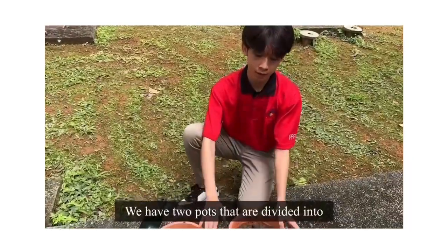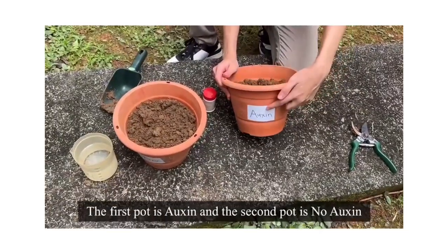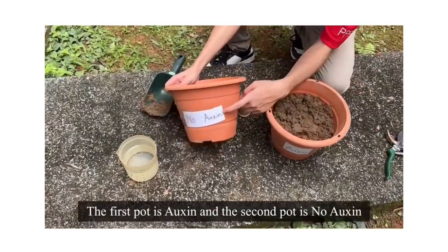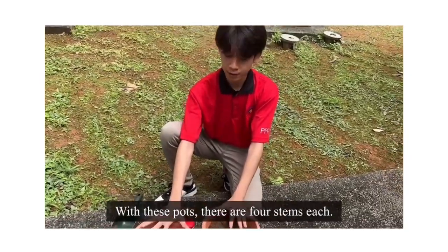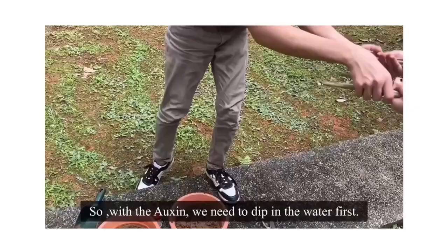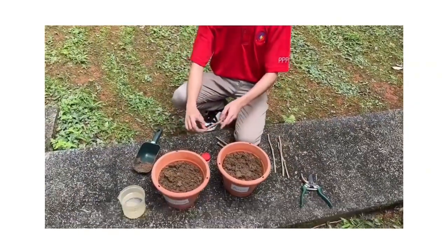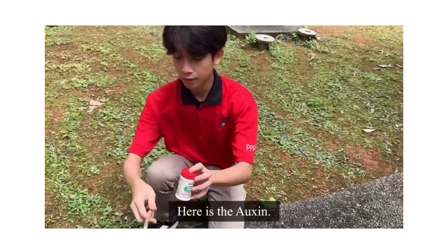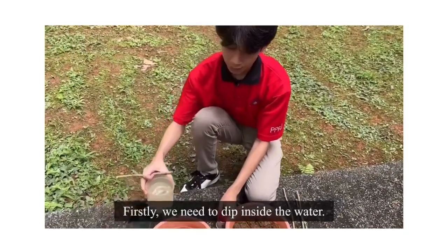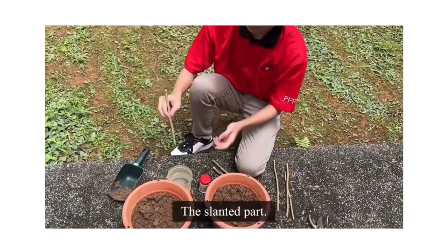There are two pots, labeled the first pot as auxin and the second pot as no auxin. With these pots there are 4 stems each. Okay, so with the auxin, you need to dip in the water first, and here is the auxin. So firstly, you need to dip the slanted part inside the water.